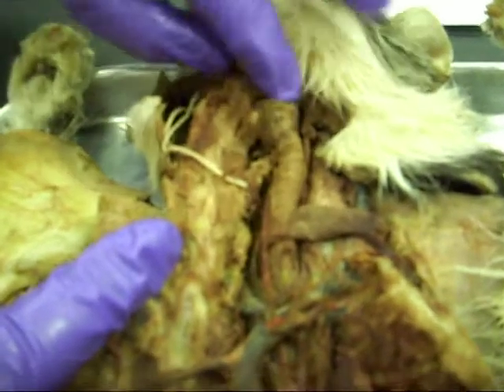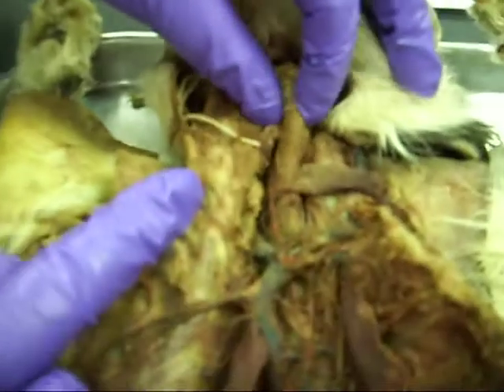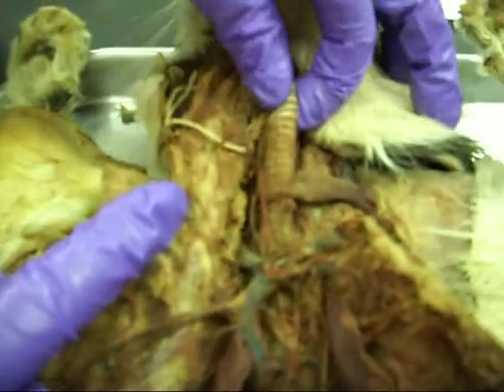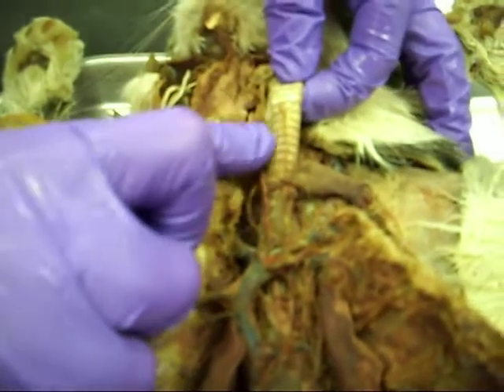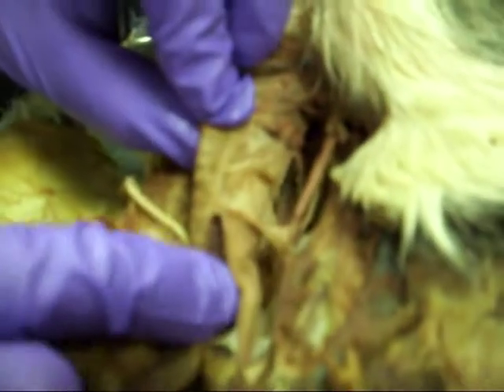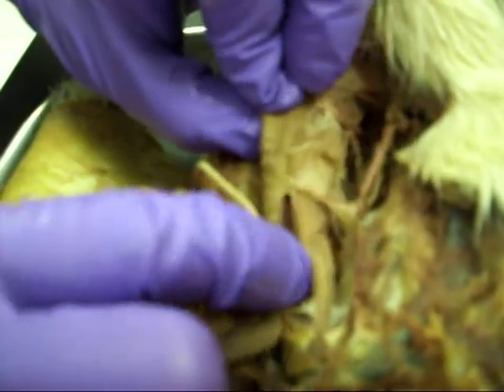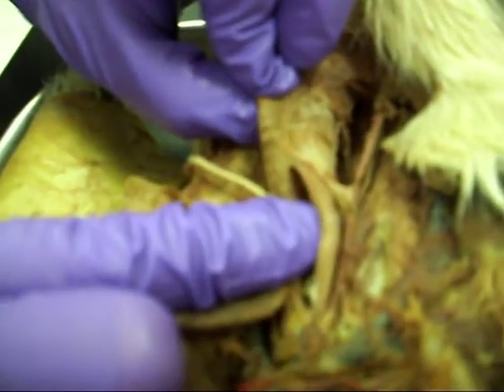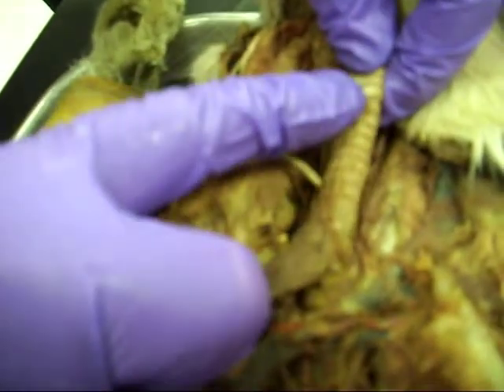You can't see the epiglottis, that's up in there. This is the trachea — you can see those ridge marks there, that's easily identifiable. Behind the trachea should be the esophagus, and you can see that because it's kind of deflated versus this rigid trachea.